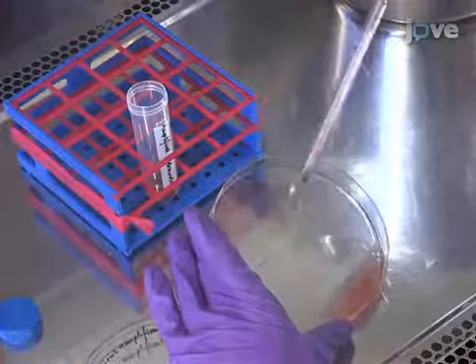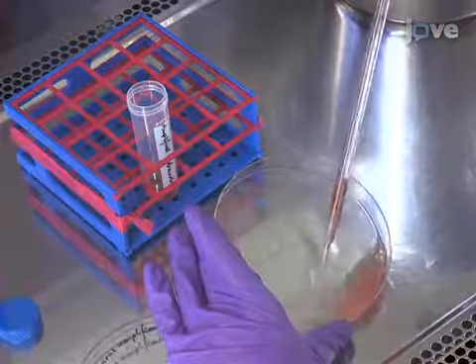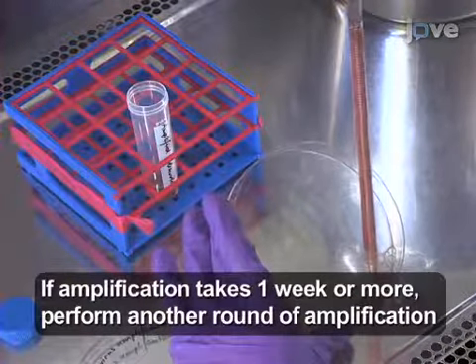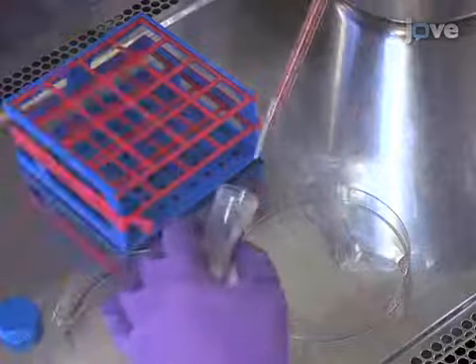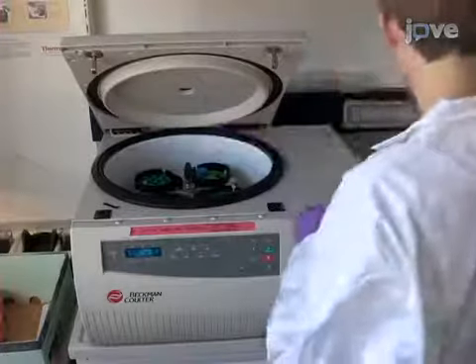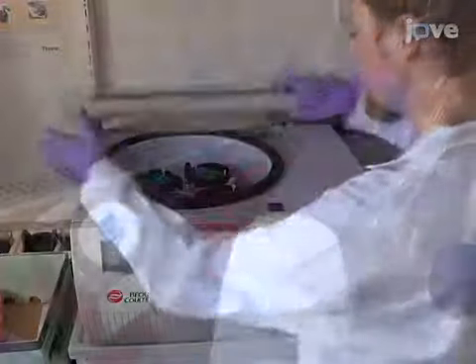Once all of the cells show cytopathic effects, but not detachment, harvest the cells by gentle pipetting. With efficient virus production, this state is reached within 48 hours of infection. Transfer the cells and supernatant to a 50 milliliter polystyrene tube. Spin cells down at 300 g for 10 minutes at 4 degrees Celsius.